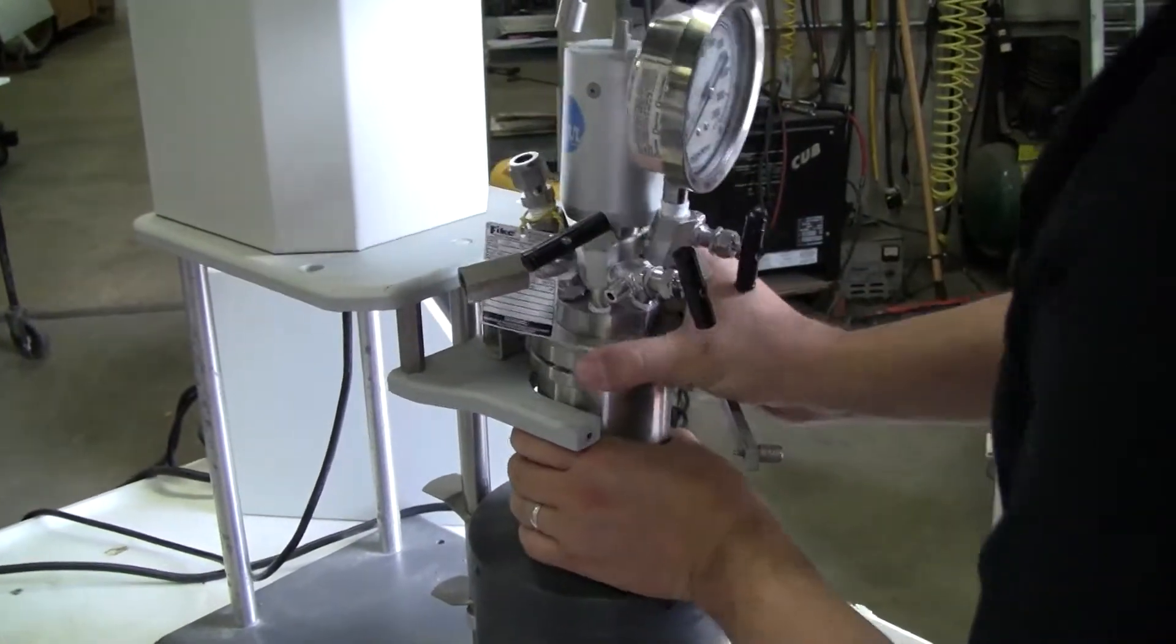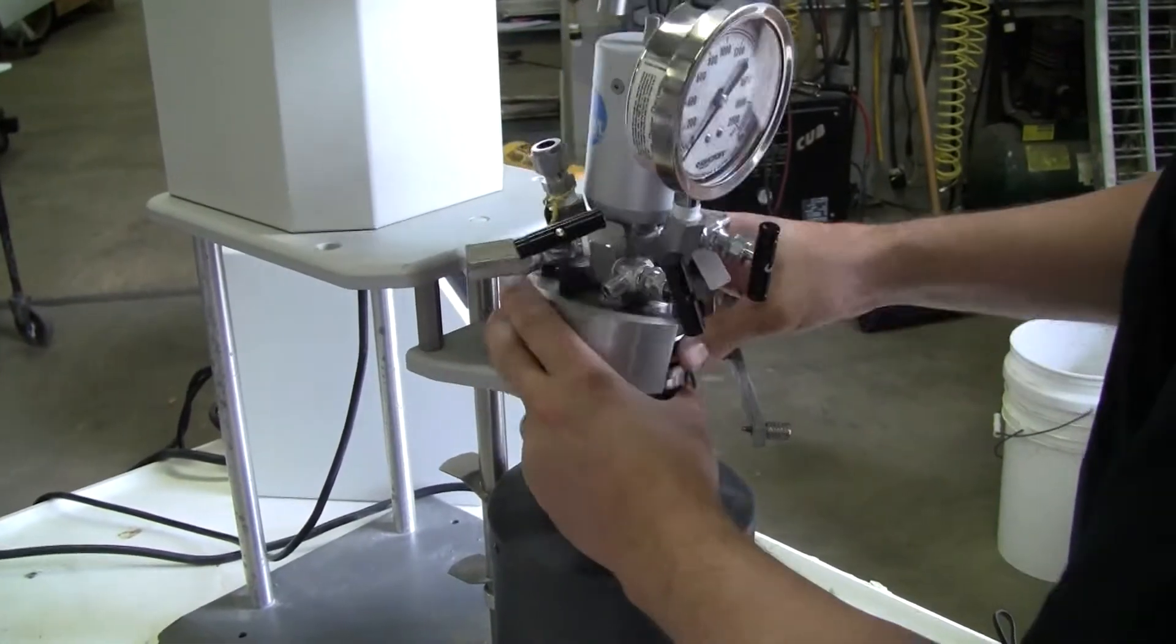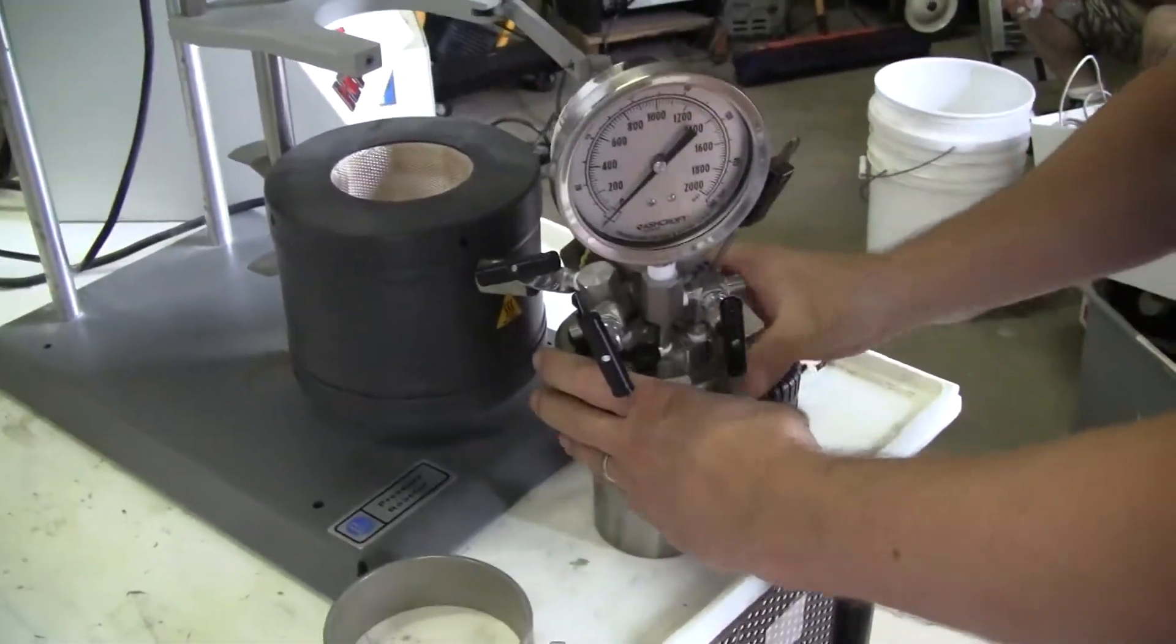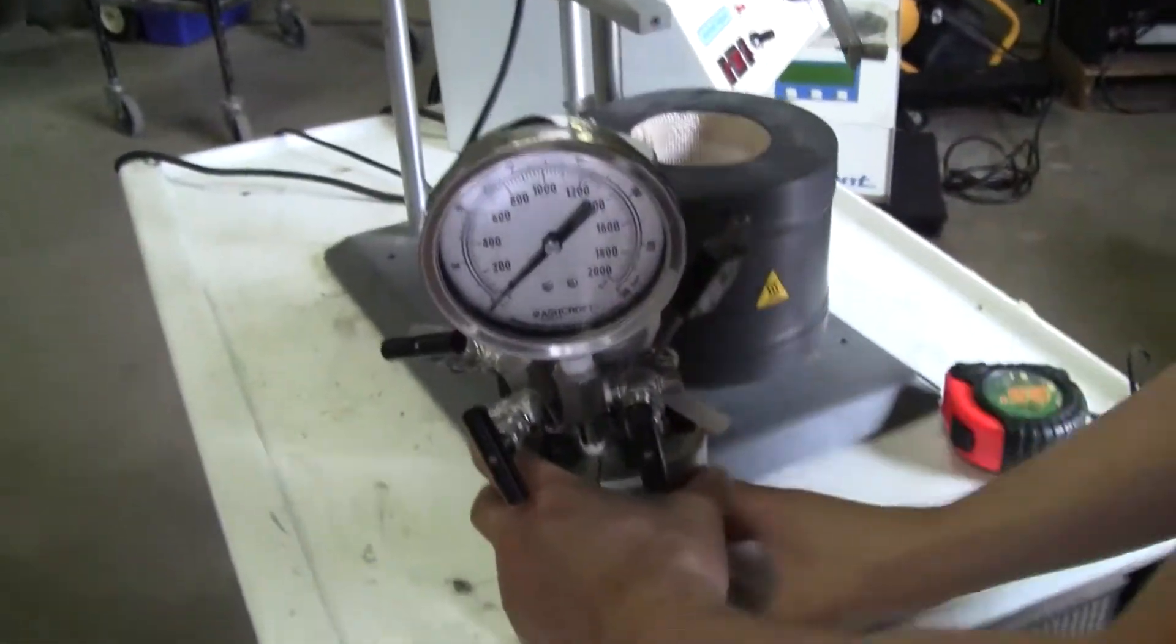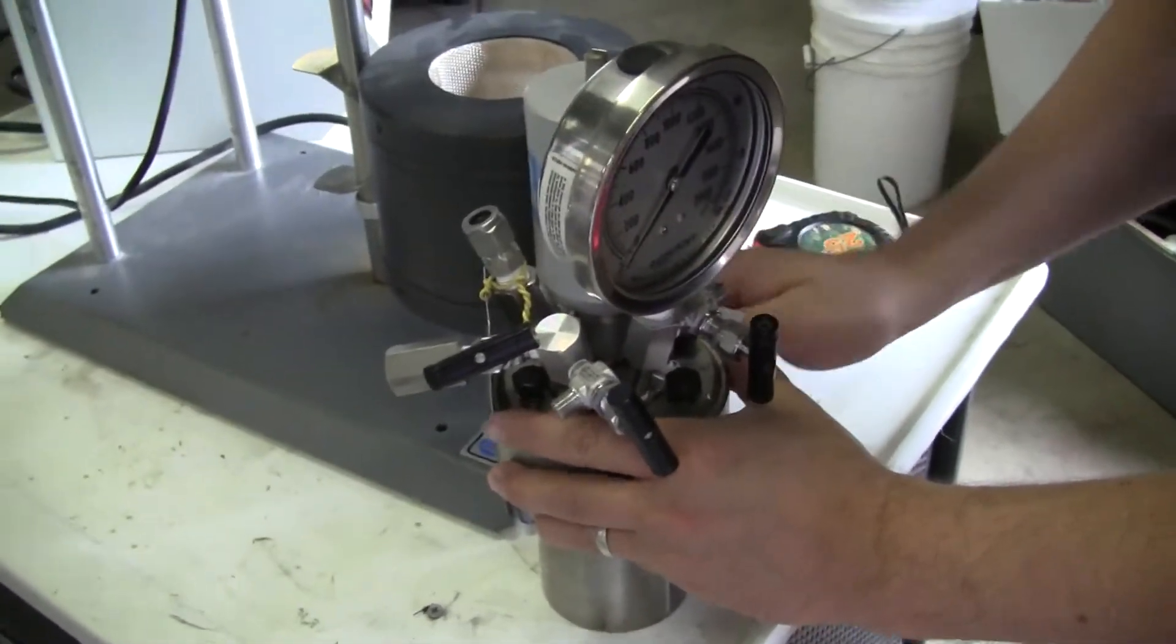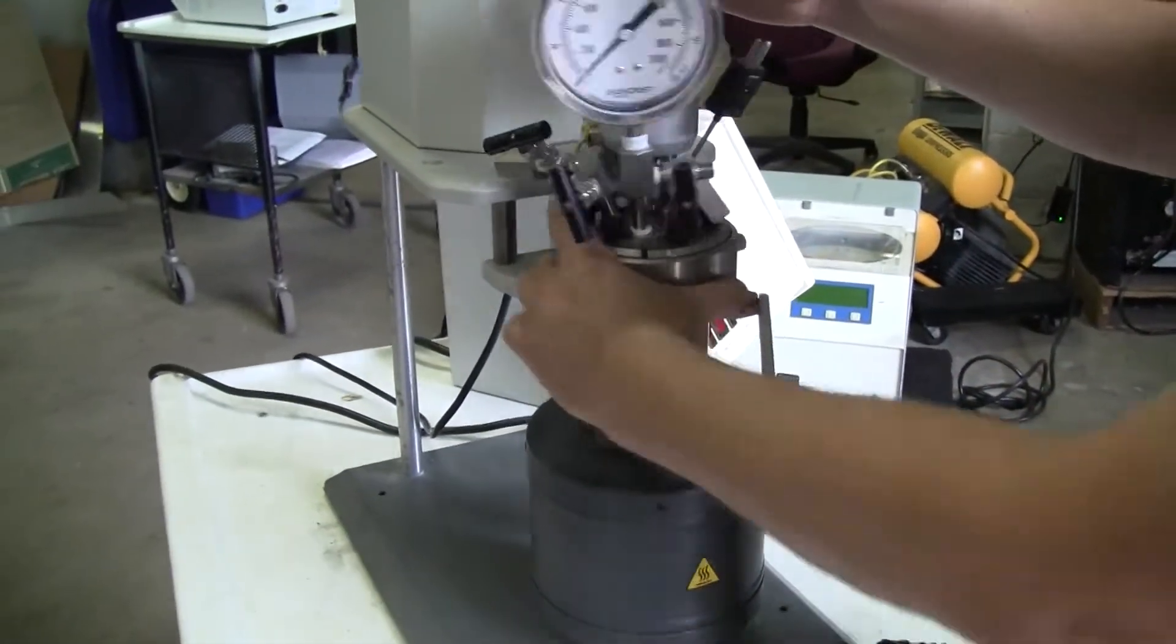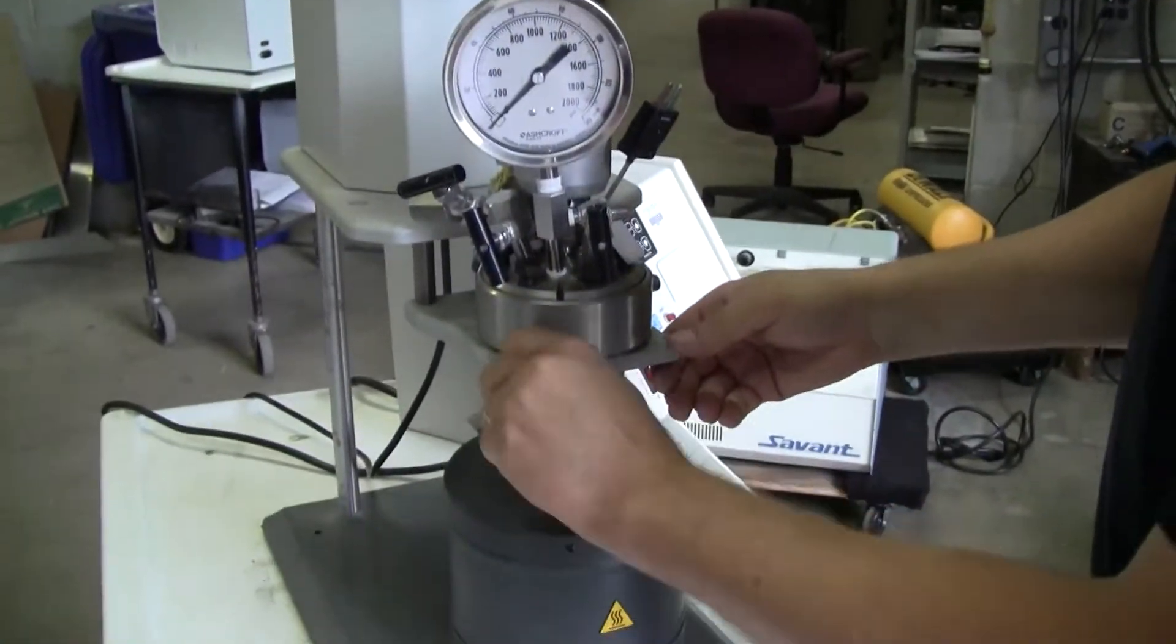The reactor would be assembled. It goes in. This mounts on the top. If you're stirring, the latch closes.